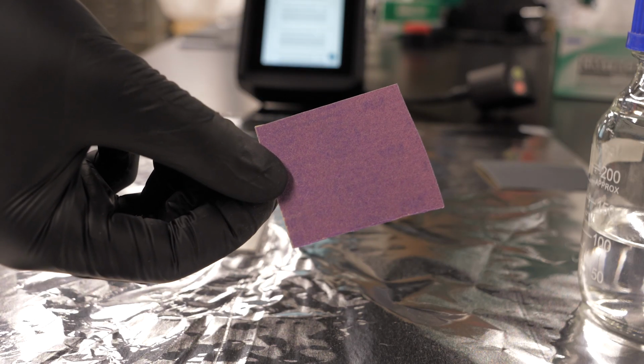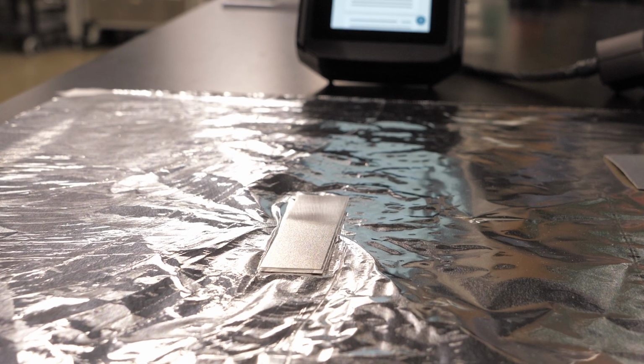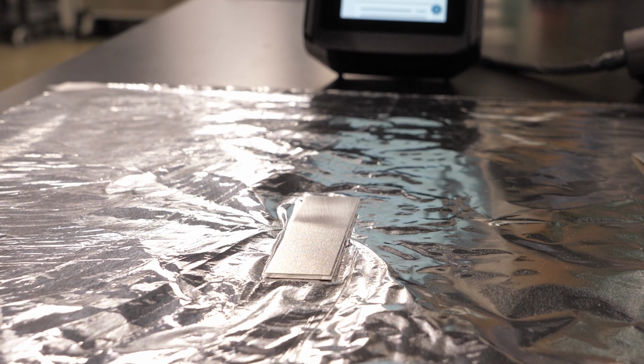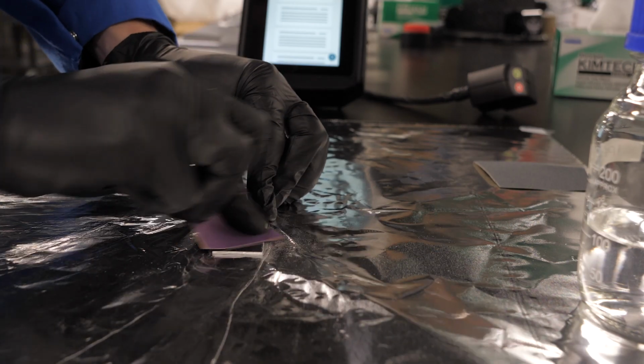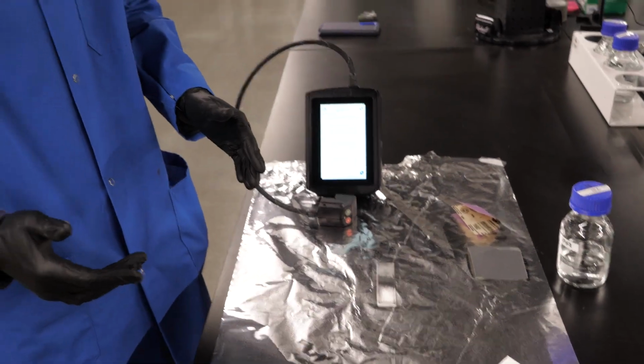So, we know what the surface analyst does when everything is going well in our process, as we're generating the data that we would expect, but what happens when something goes wrong? Take, for instance, this sandpaper, which is similar to this type of sandpaper, 180 grit aluminum oxide. We've got our same clean aluminum surface, same operator, different type of sandpaper, but in theory it's the same. Same operator, same type of sandpaper, same surface, we should get the same results, right?